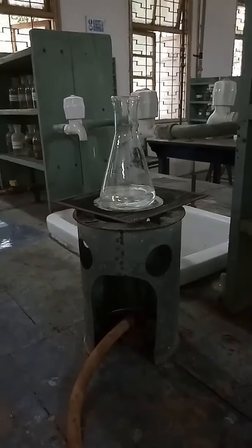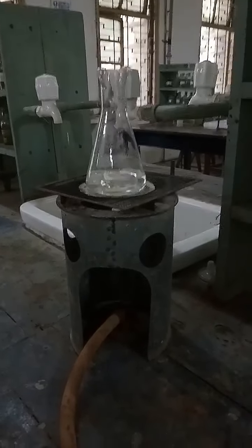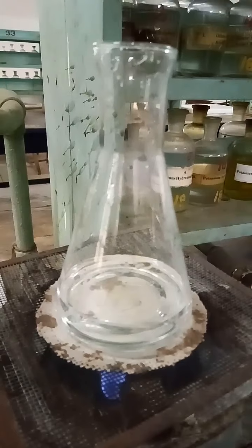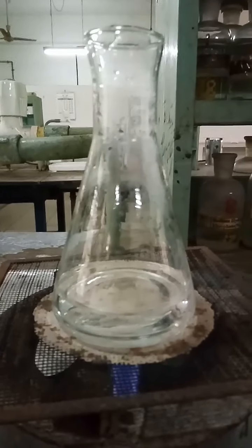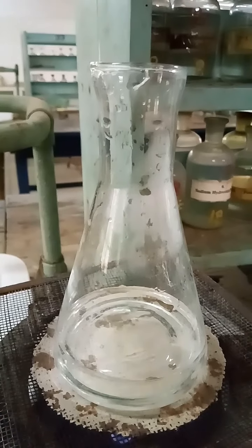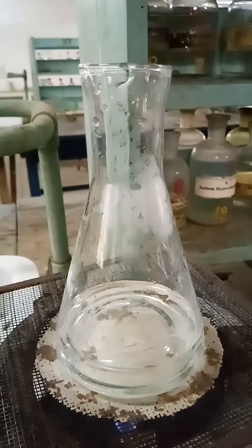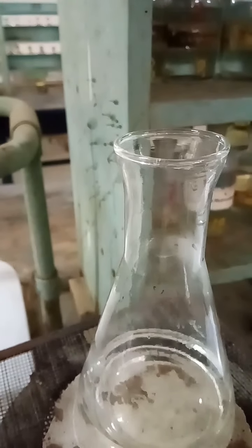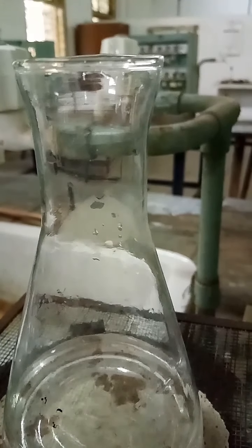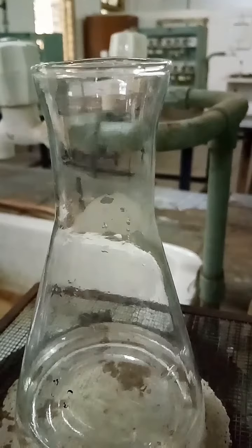And now we will heat the contents of the flask to 70 to 80 degrees Celsius. When the vapors start condensing on the neck of the conical flask, we assume that we have reached 70 to 80 degrees temperature.